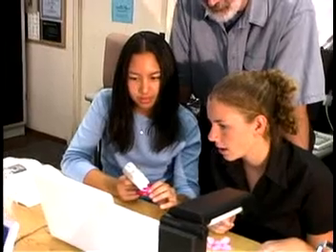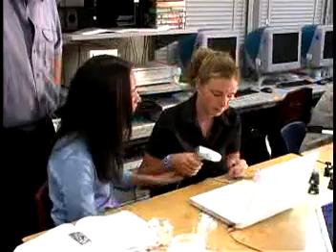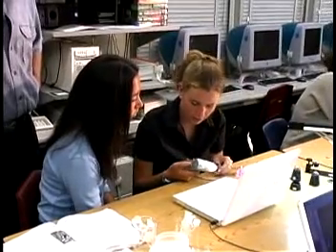Once a student has captured an image in the lab, there's several things that they can do with it. Number one, they can print it out, just as it is, and then they can label it by hand. If we have software, then we can do more. We can put it into the computer and use a digital imaging program to label it on the screen and then print it out. We can also do it to allow students to make presentations before the rest of the class.